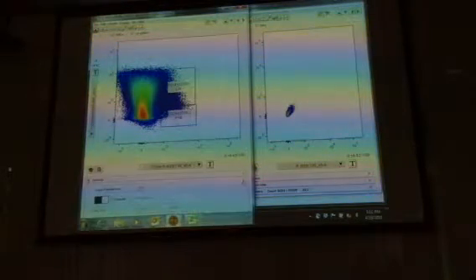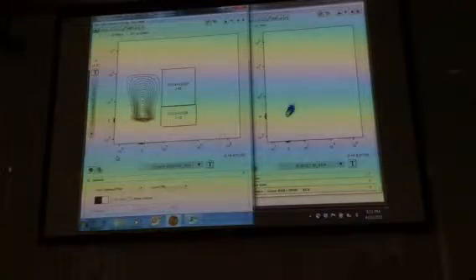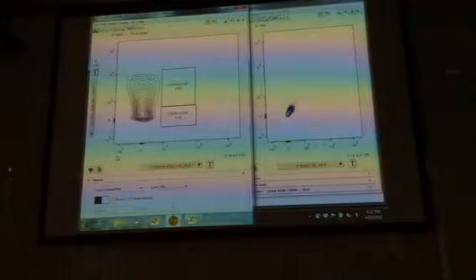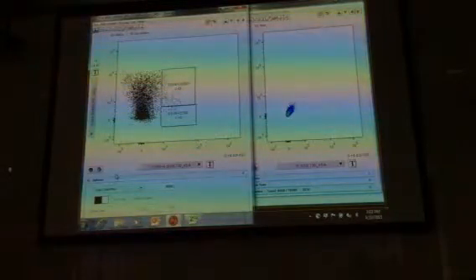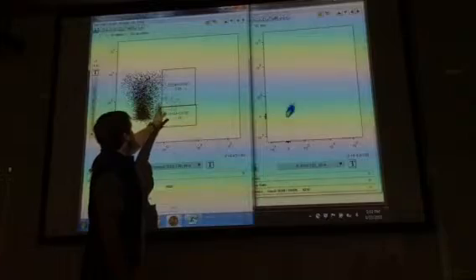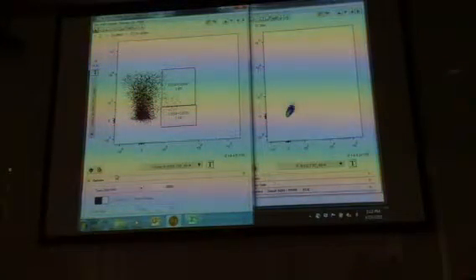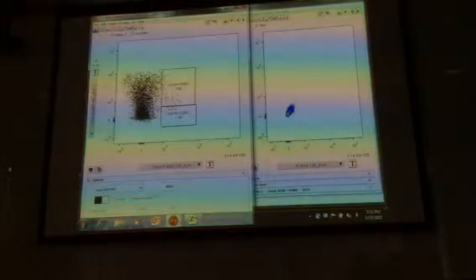You could also look at this, I mean, we're using pseudo colors. You could look at other things like contour plots, density plots, something like that. What the dot plot is doing is it's just showing you, and then yeah, like you say, with this dot plot, maybe you are a little bit too far over here. Maybe according to the dot plot you would shift it over so the cutoff's somewhere about here. That's possible as well. However you do it, you have to be consistent. And you have to be able to justify it to yourself and then also to whoever else is going to be looking at your data.